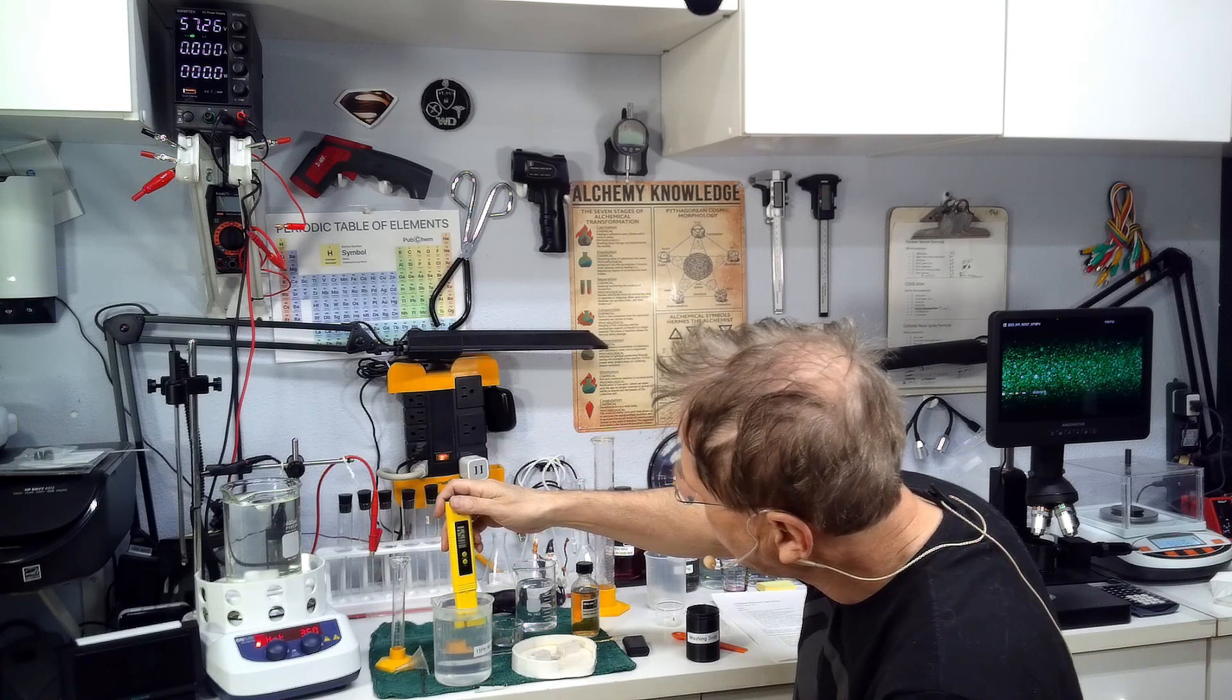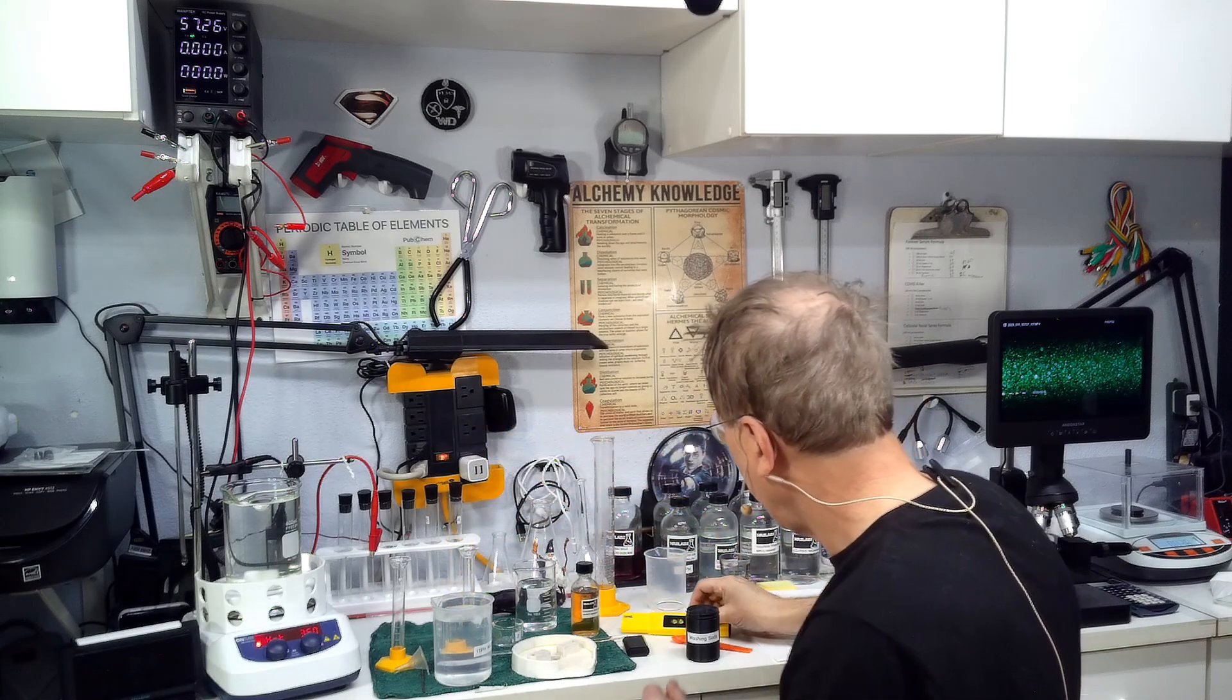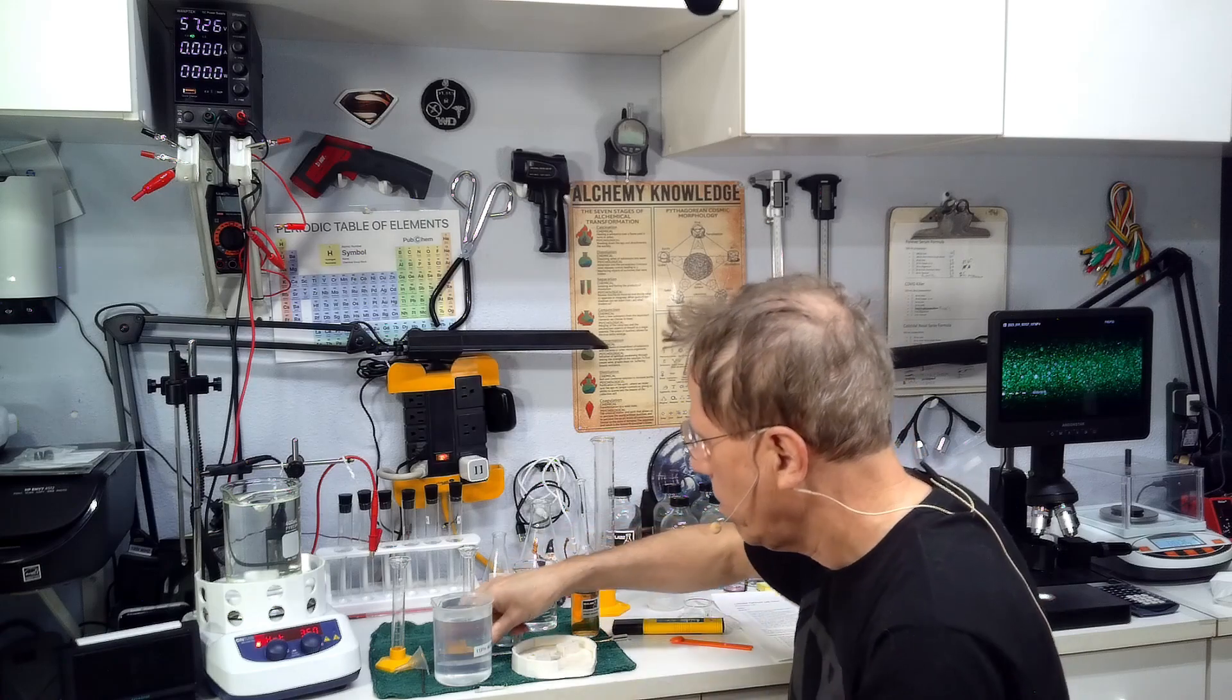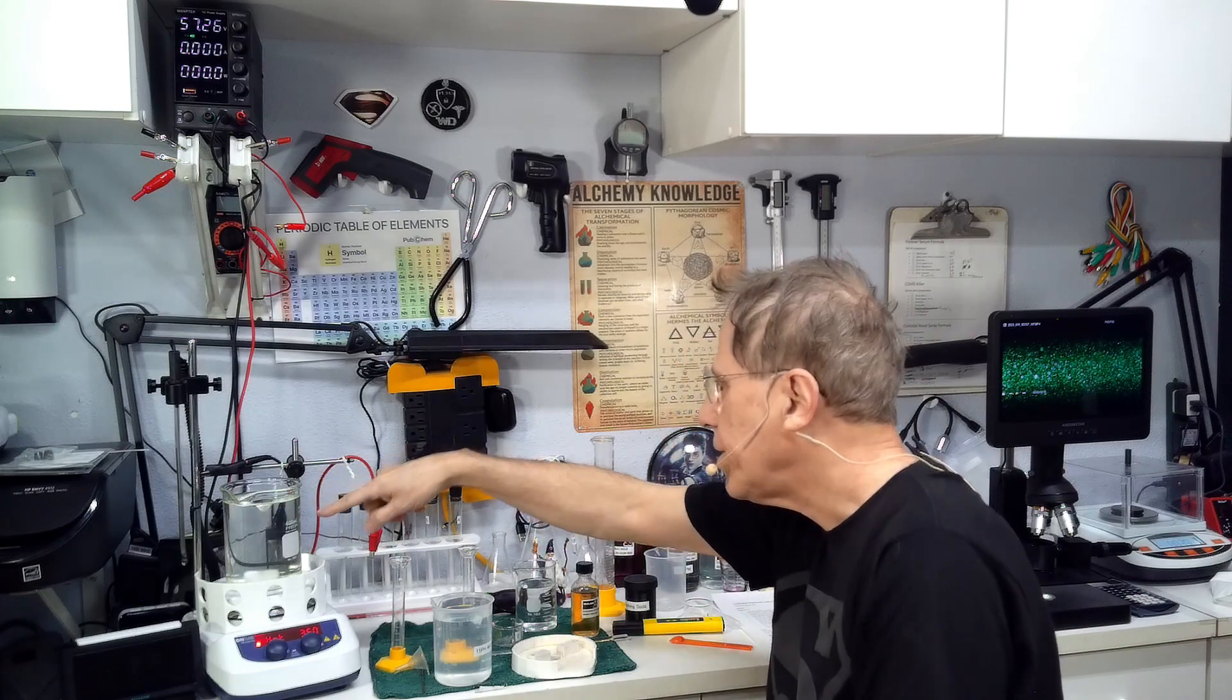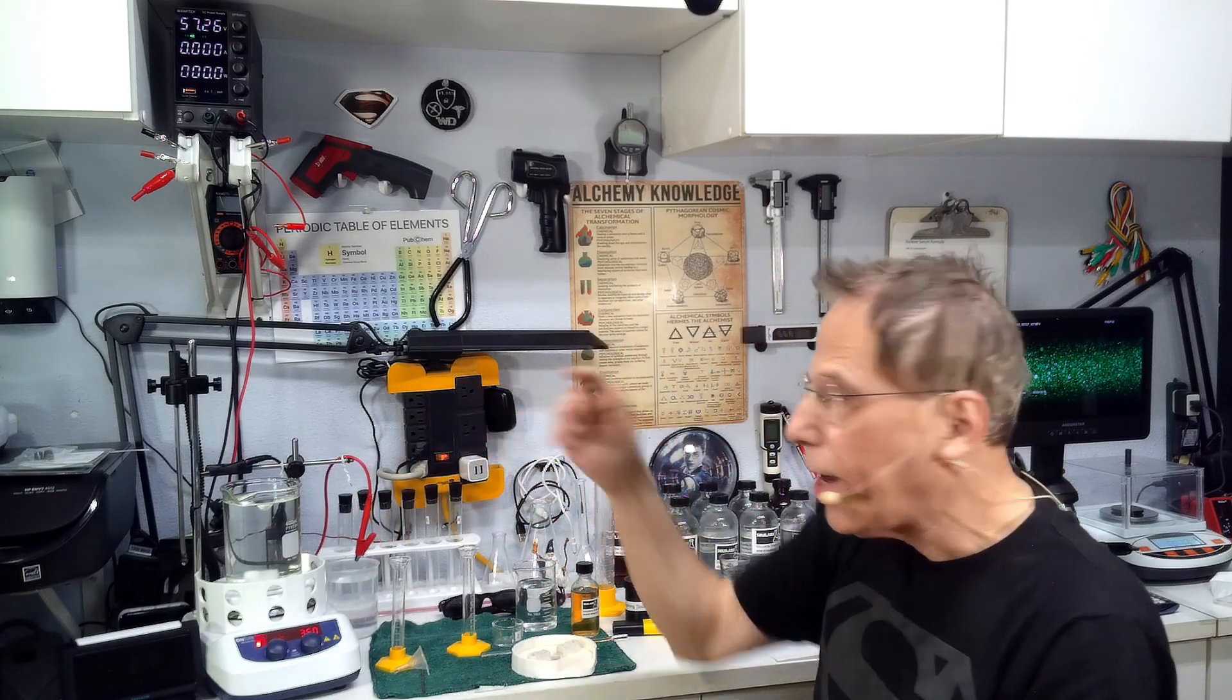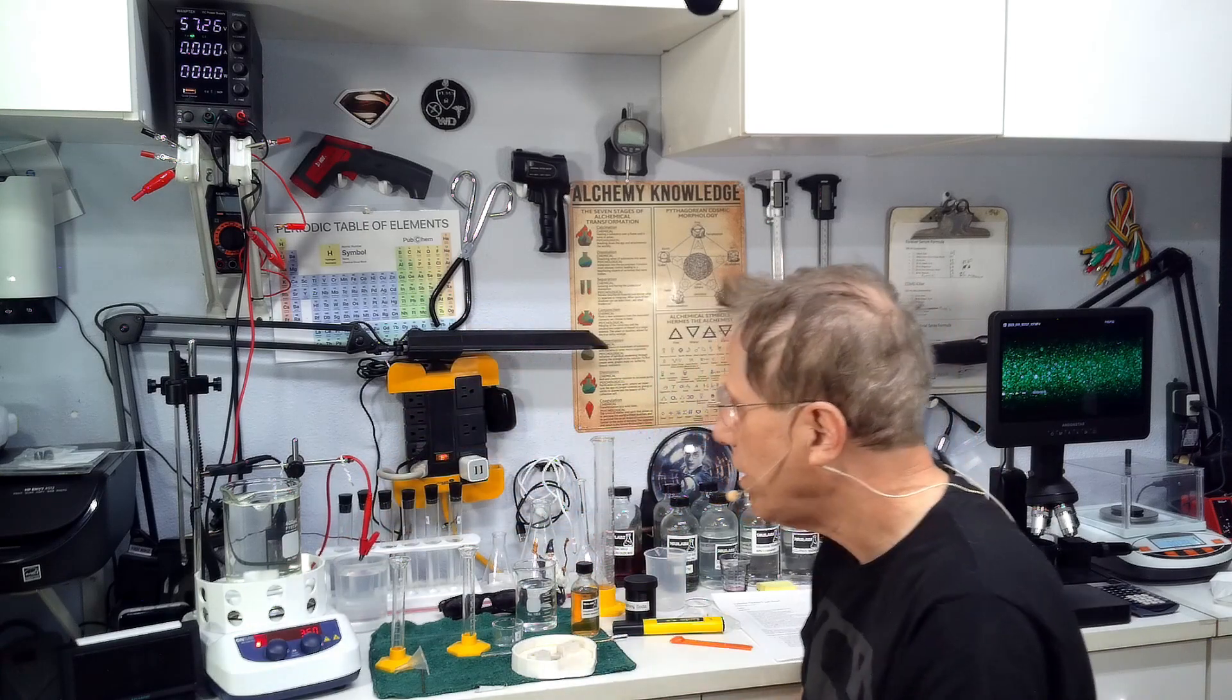We're going to test this and we got 10.56, so that's 10.6, that's pretty good. As the water evaporates you're going to use this to replace the missing water to keep the solution at 500 milliliters. Right now we're around 600 milliliters because we added all the stuff in there.